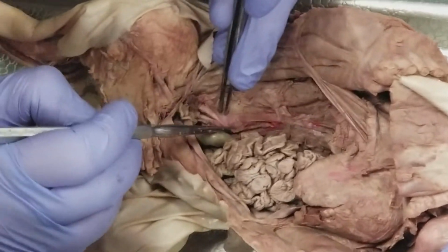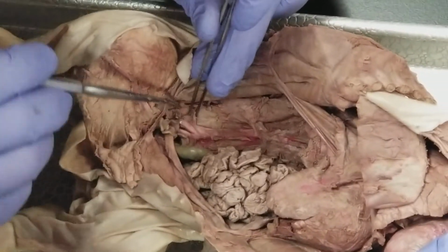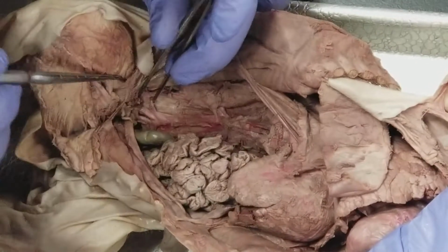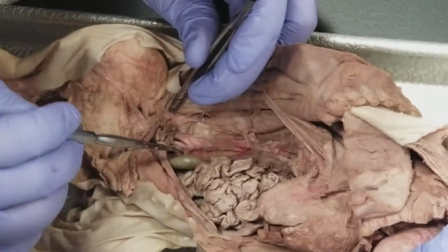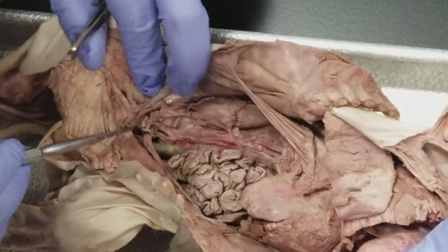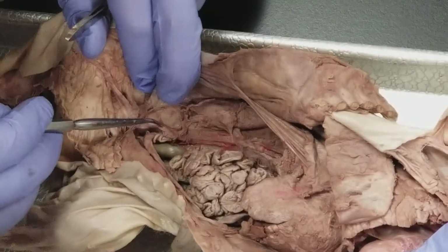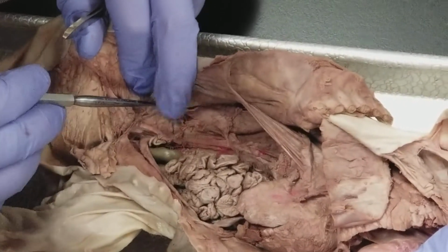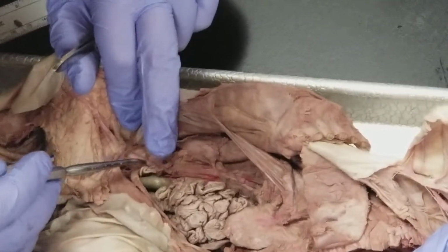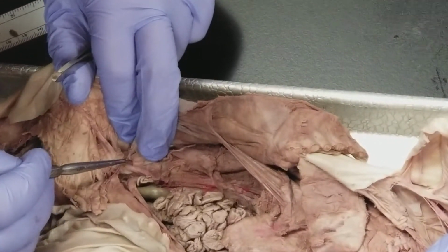So the vena cava is going to branch off to form the common iliac right and left, and then shove that out of the way. So you can see it underneath the common iliac artery. We'll talk about it again in a second.